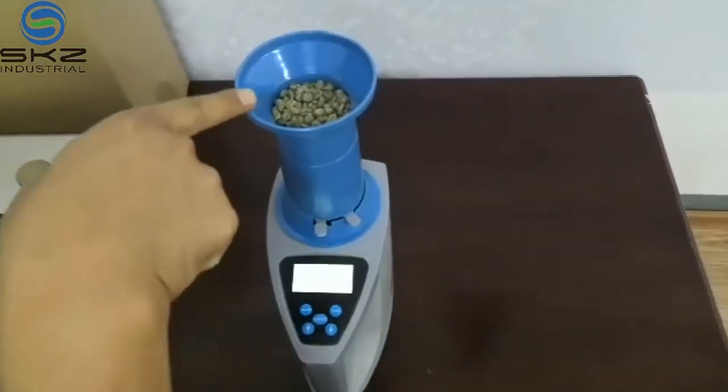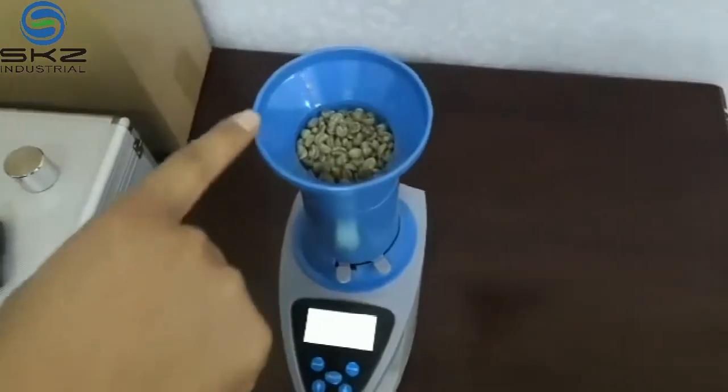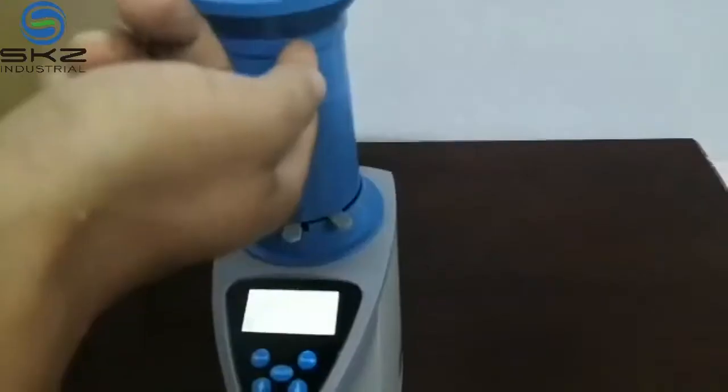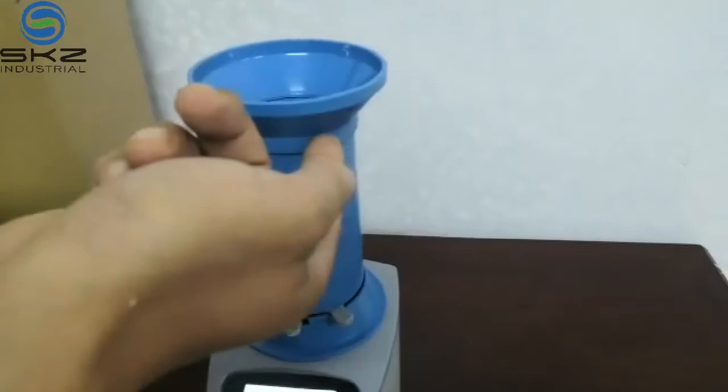Put the sample just along this line. That's okay.